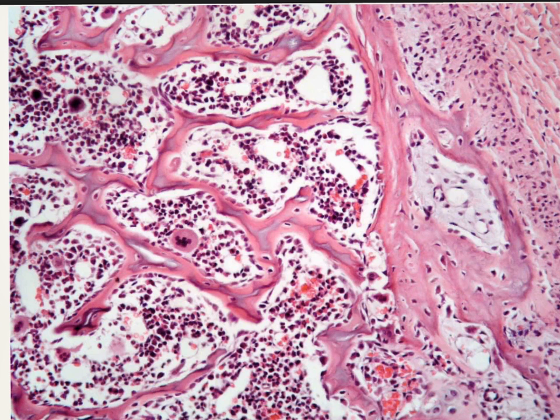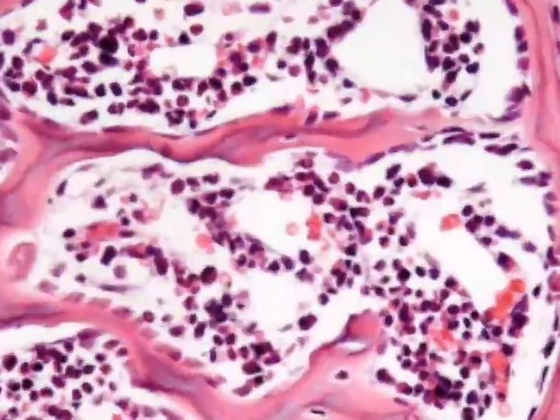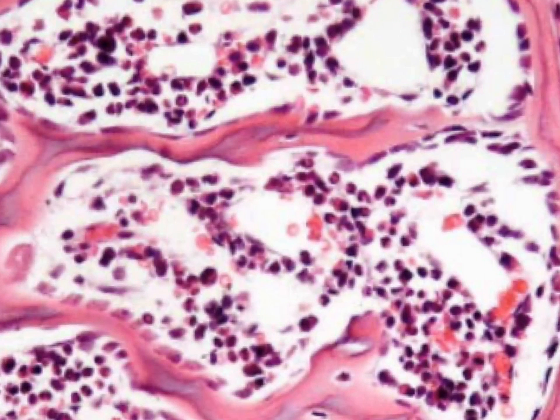In the spongy bone trabeculae, I can enlarge the picture more and you can diagnose what. Here in the bony trabeculae, this is the red bony trabeculae, we have the osteocytes inside. While in the lining here we have lining cells, these cells here are the osteoblasts.